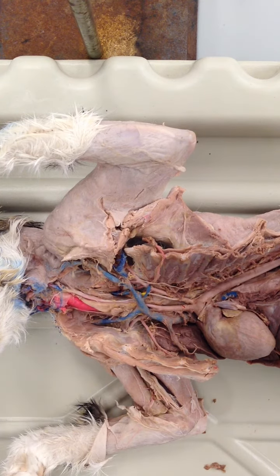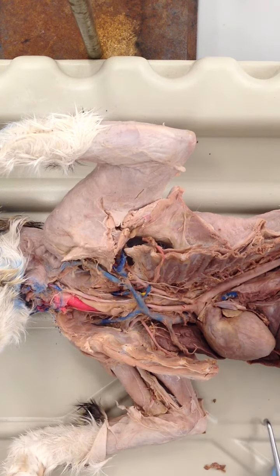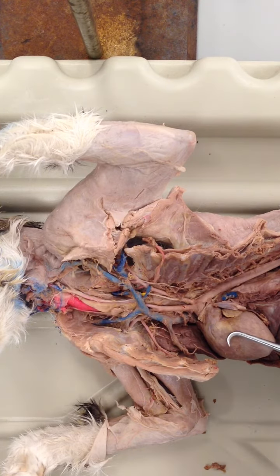So what we're going to do is start off here in the chest, go from the heart and look at the branches from the aortic arch. We're also going to look at the branches of the superior vena cava. Just to orient ourselves, we have the heart here in the picture, and we're going to work our way towards the neck region or cervical region of the cat. As I go through the vessels, I will try to point out the differences between the human and the cat, and any structures that might be missing because I removed them during the dissection. So again, here's the heart.